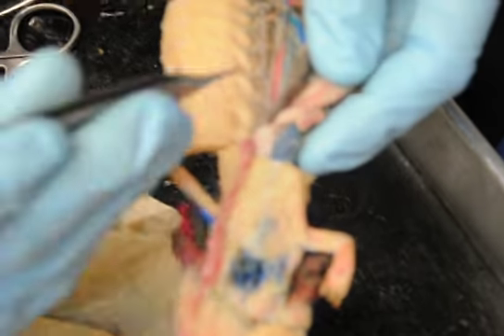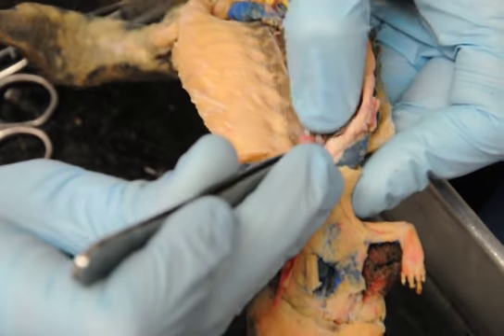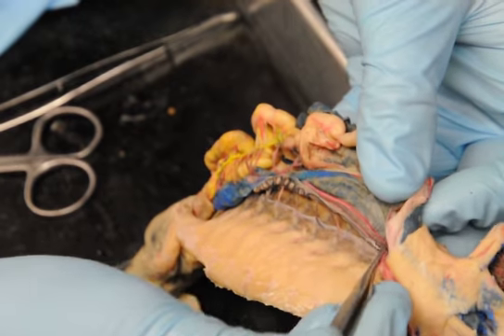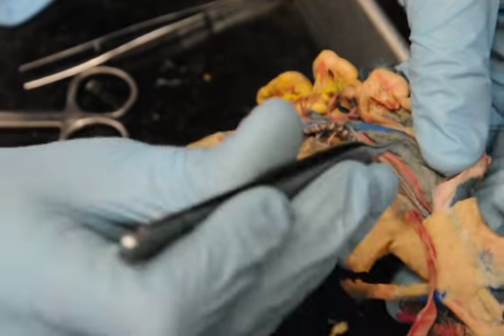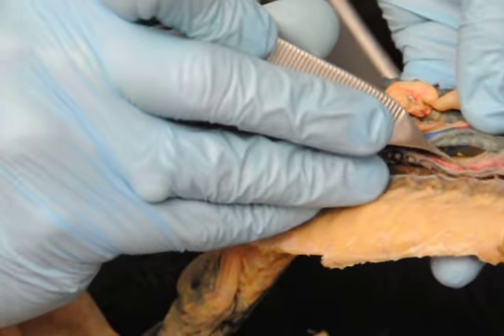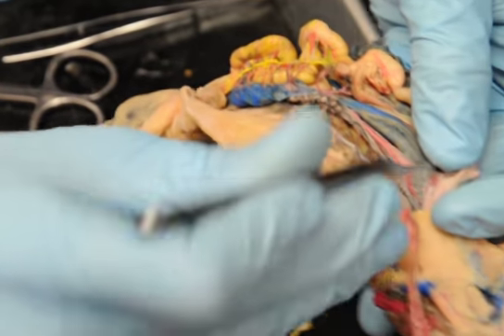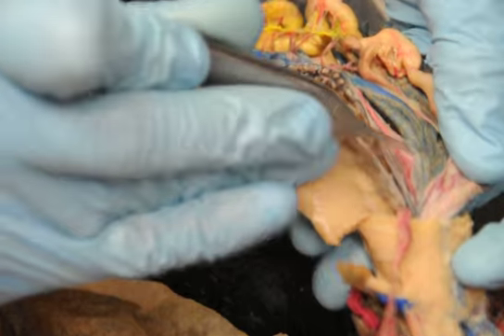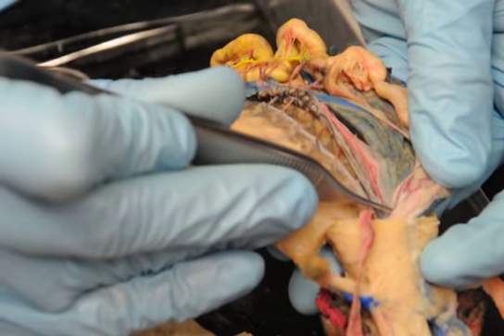The lung. So, with the artery, this one isn't separated off the way some of the others of yours are, but you've got the main dorsal aorta coming down the middle, and so that's the middle there. What you're seeing poking through from the other side, that's another lung. So the middle is right here. The first artery branching off the aorta up to the stomach, right here, which has actually got some blue in it on this one, that's your gastric artery.